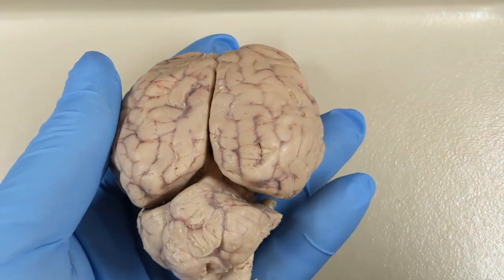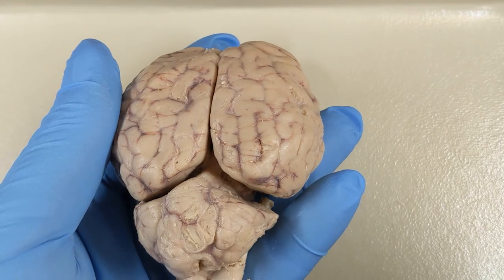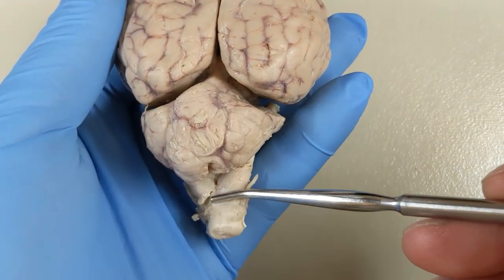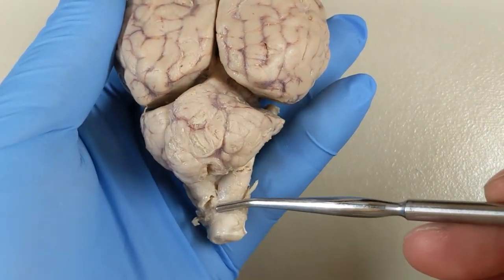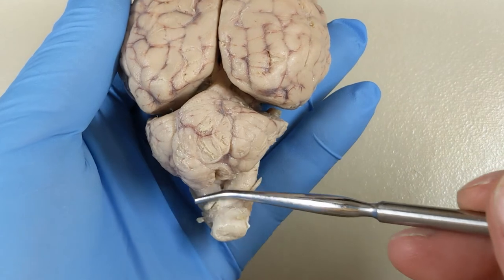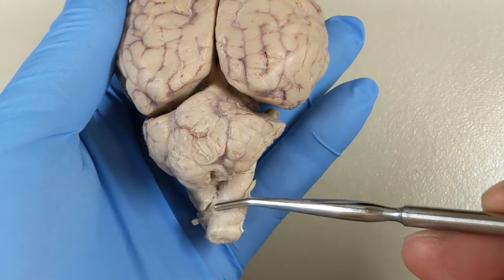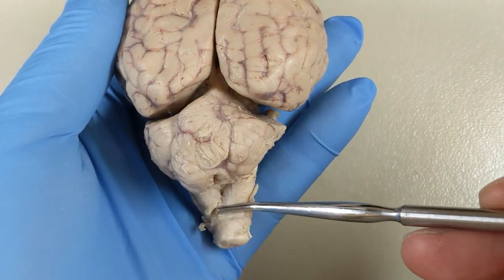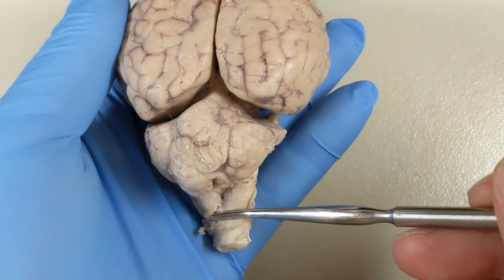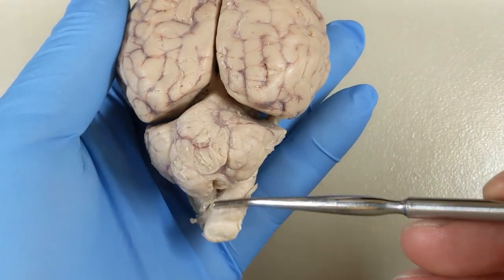Back here you've got the spinal cord and the medulla right up here. So spinal cord from here back, medulla from here forward.